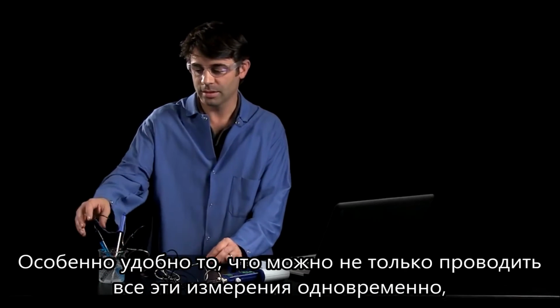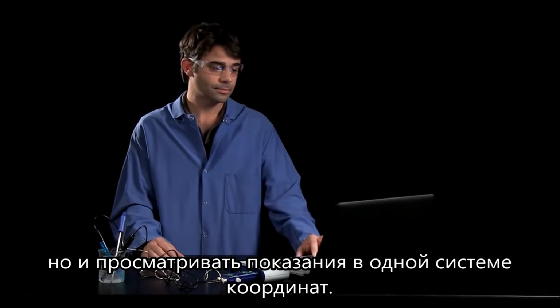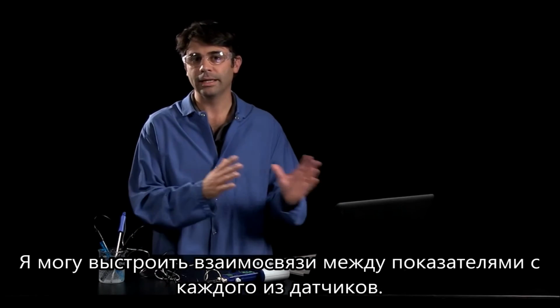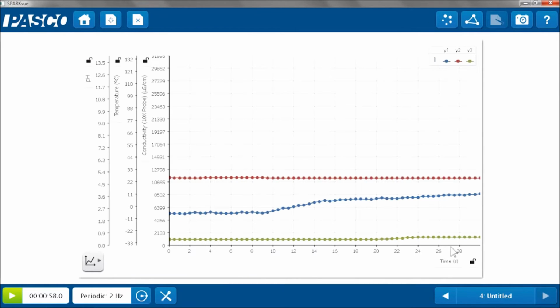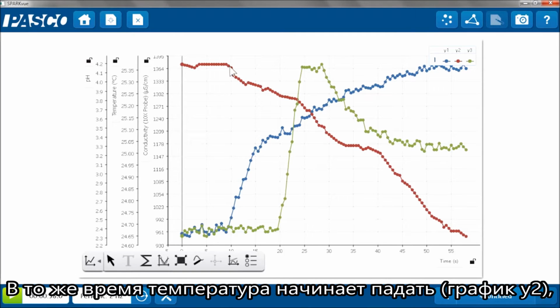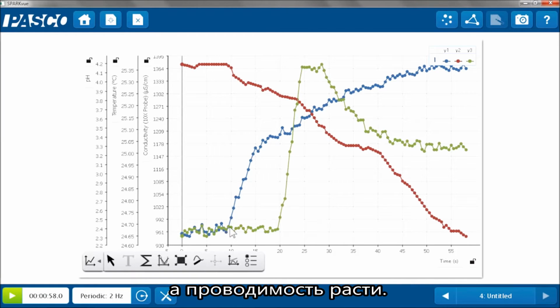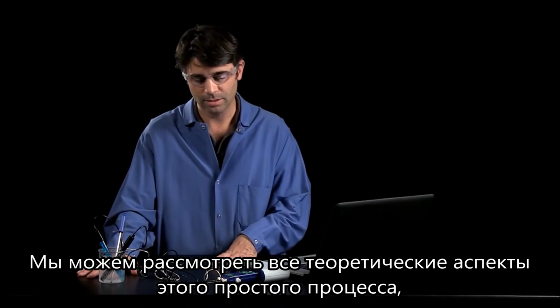Now the really nice part about this is, since I was making those measurements simultaneously, I can view all of them on one graph. And I can make connections between what was happening in each of those properties. So we'll look at our next page, and we'll auto-scale it. Now we can see my pH, which was my Y1, was increasing. At the same time, my temperature started dropping. It's my Y2. And the conductivity started to increase.